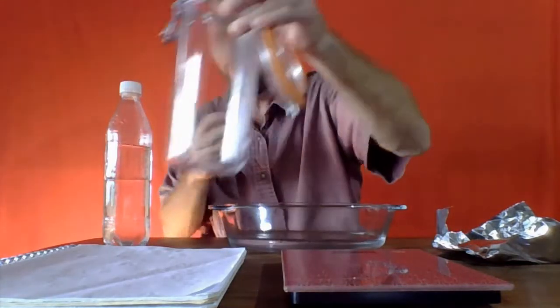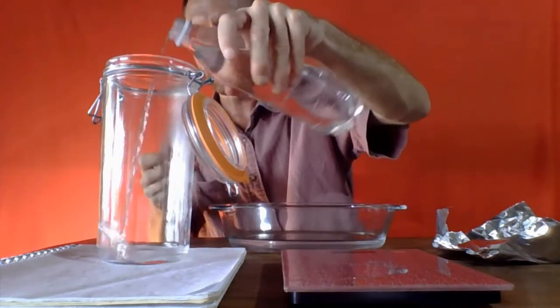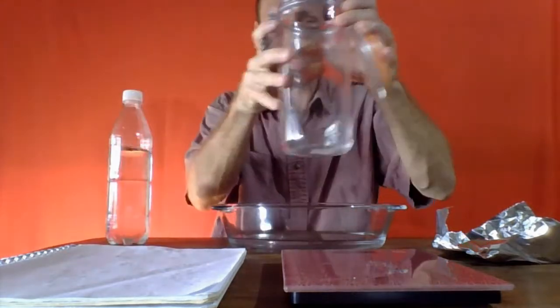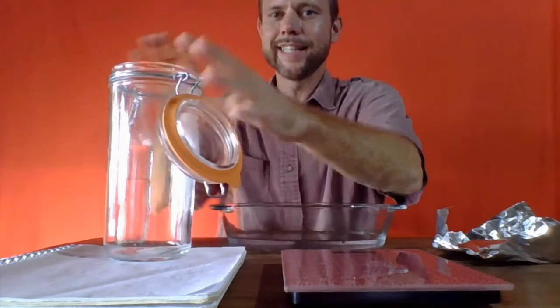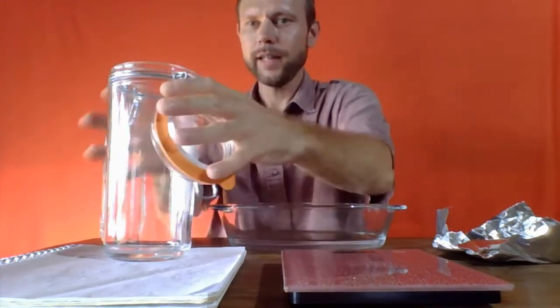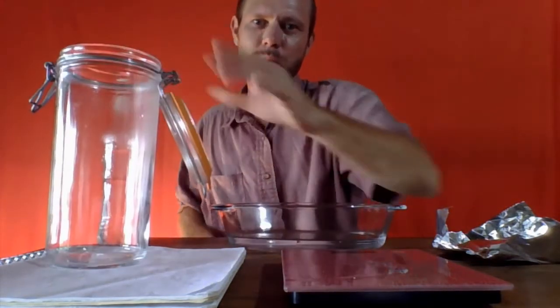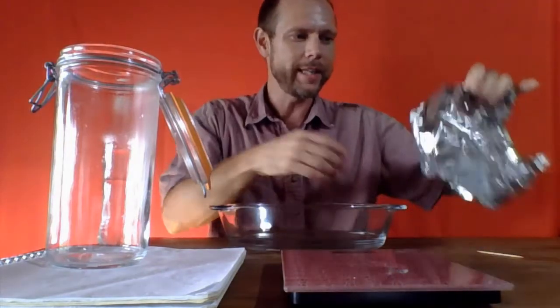So we're getting a little bit more water that we need to cook off, but I want to make sure that we've got all the salt out of this first container and into the second container that's going to go in the oven. So I'm going to rinse this thing out maybe a few times with some clean water. And now at this point, there might still be a drop down there, but I'm hoping at this point that it's just water. We've got all the salt plus a lot of water into the dish.